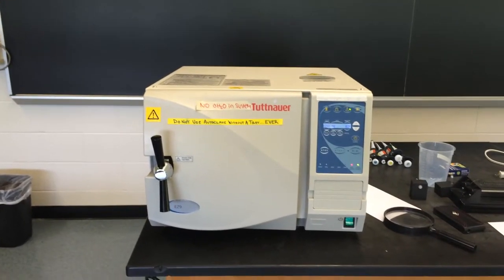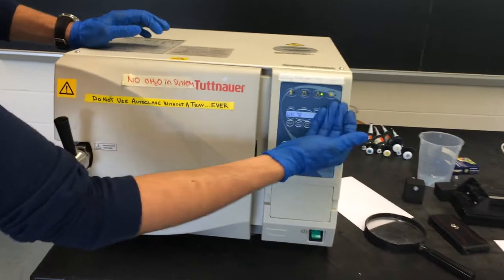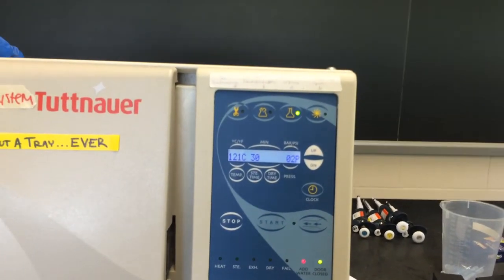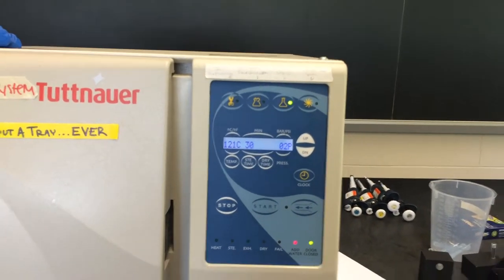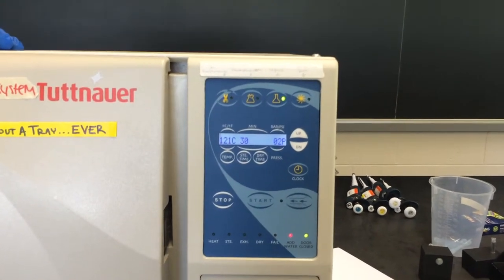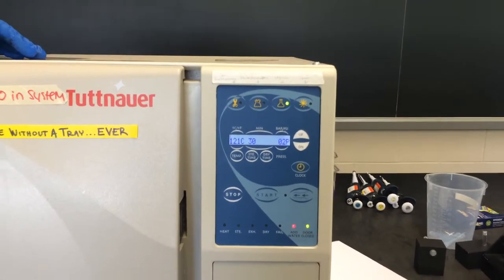Then, you can press whatever button matches your protocol. You want to wait a minute or so after the autoclave starts, just to make sure that there are no problems with it.